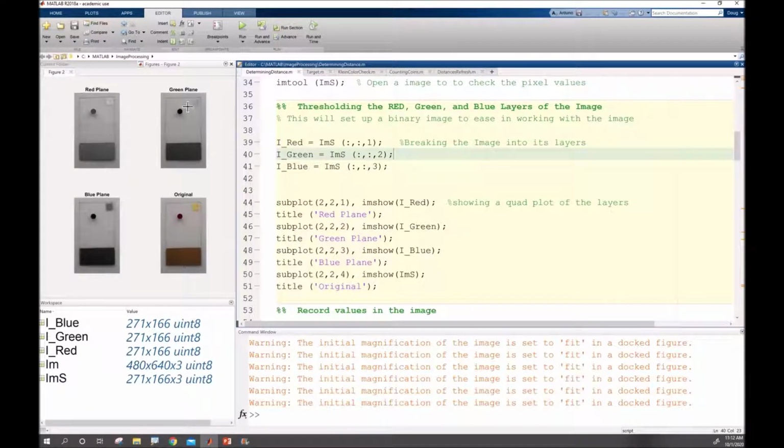Alright, so I've got my red plane, a green plane, a blue plane, and then I've got my original. What I'm looking for in this is the one that has the largest difference between the images that I need and the background. Because what's going to be ideal is if I can say, hey, anything that's darker than this is something we want to keep, anything that's lighter than this is something we need to get rid of to make it work. I'm going to choose the green just because it looks like these two are much darker than my background, whereas the red looks a little bit closer. The blue looks closer with this yellow here.